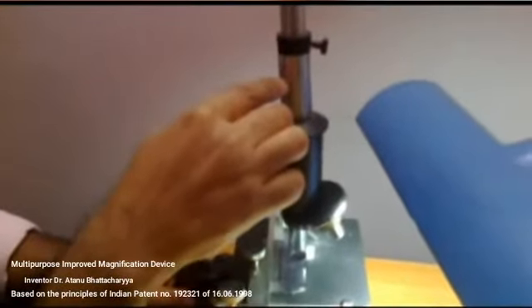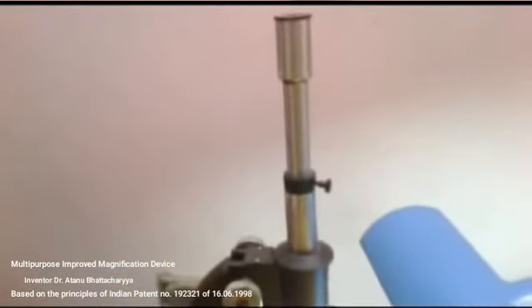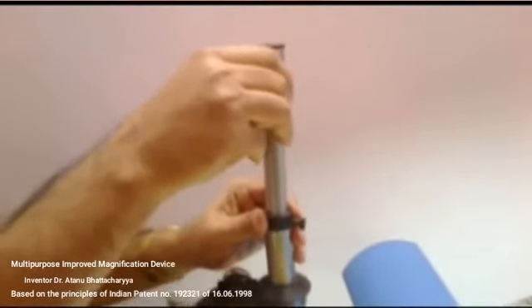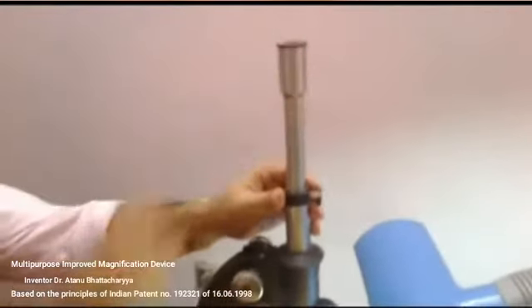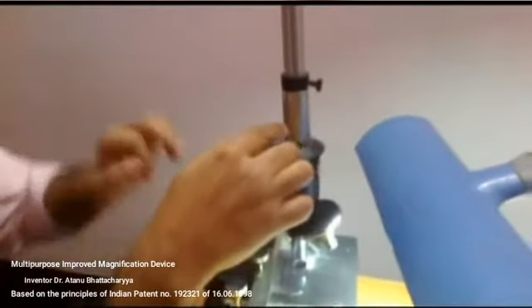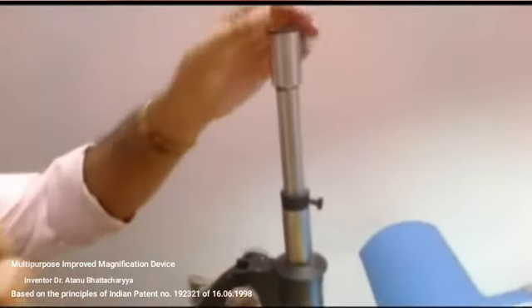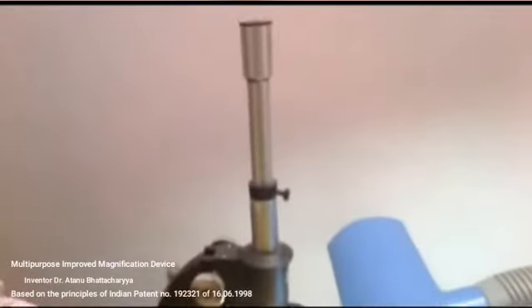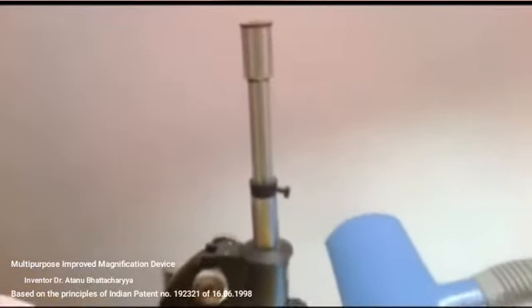If it magnifies it 4 times, then 160 times magnified. If it magnifies it 10 times, then 1600 times magnification can be achieved. Actually, 1200 times magnification can be achieved very clearly. Practically, it makes an inverted image. This objective again inverts it, so the image becomes erect, and the eyepiece always makes a virtual image which is always erect. So through this device we can always see the erect images, and for that purpose it can be used for dissection purpose also.